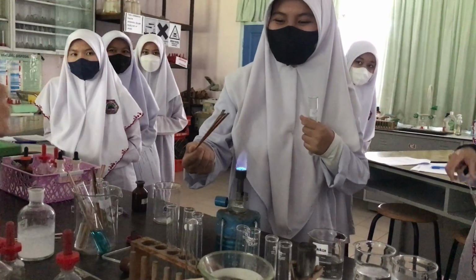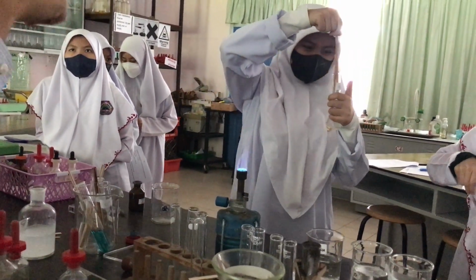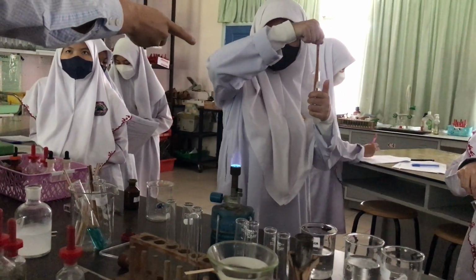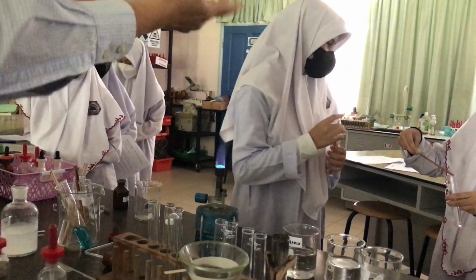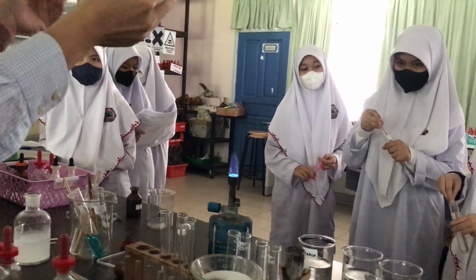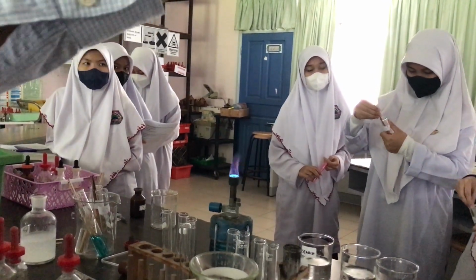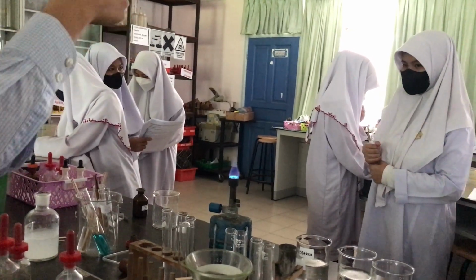Alright, so what color was Na plus again? Yellow. Not the solution. What color is the solution? Colorless. That's why we cannot see the thing. We have to use that. All three are colorless solutions. How do you know which one is present? Flame test. It's stated there, right? F-L-A-M-E. Flame. Using fire. Flame test. Test of what? Test of the cation.